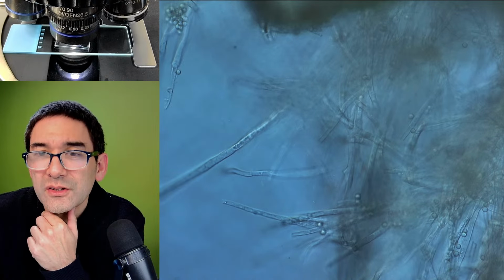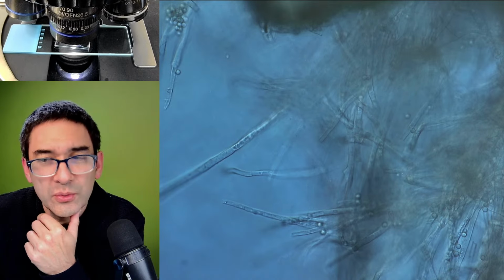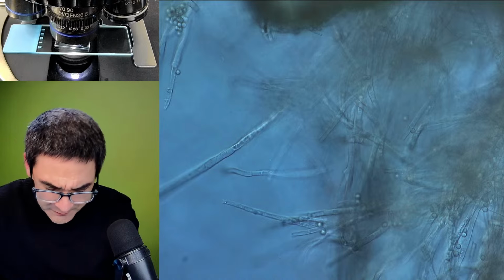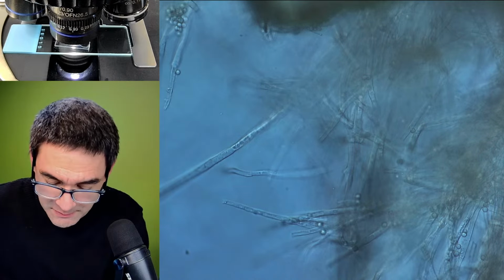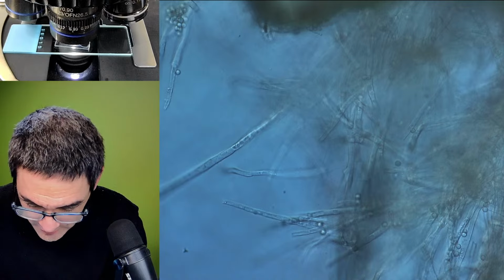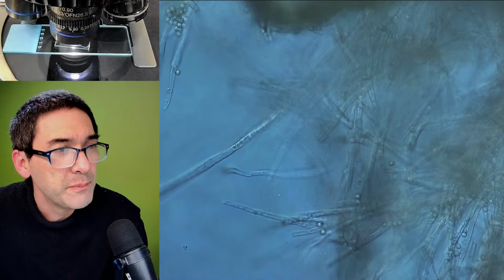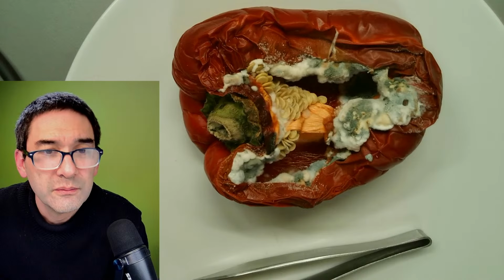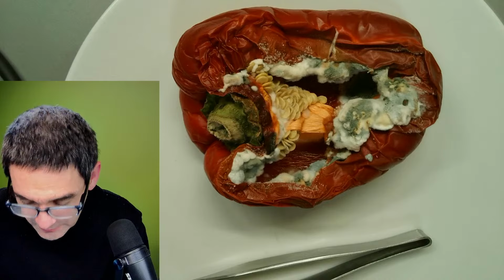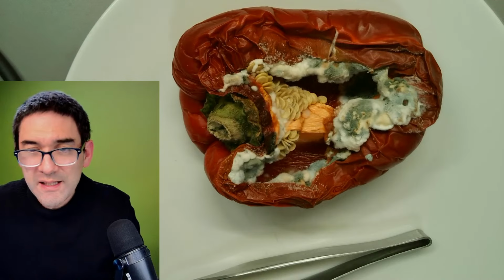So I'm going to quickly look at the toothpaste comparison. I'm still looking for some toothpaste that might contain some diatomaceous earth. I have to find one. So this was basically the vegetable, the pepper here. Which now that we've looked at it, I can throw away, right? Yeah. The apple seeds, very good.